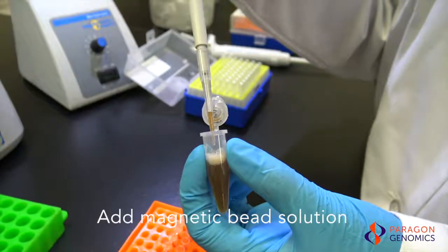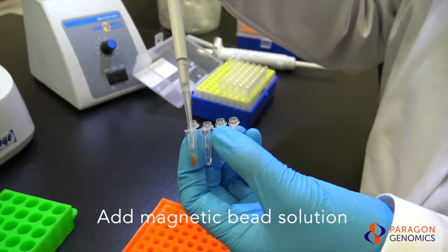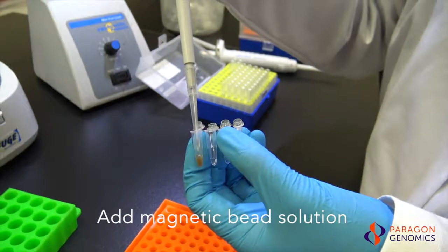While aspirating, draw in the solution slowly and wipe off any droplets remaining on the outside of the pipette tip. Dispense the beads slowly, making sure to add the last drop inside the tip. Rinse the tip in the solution as needed.